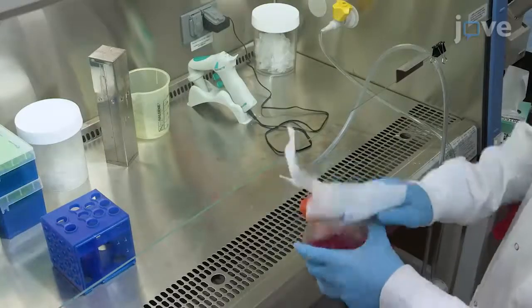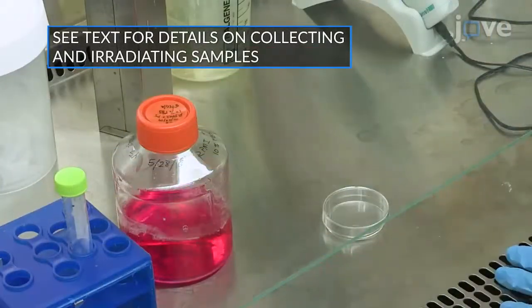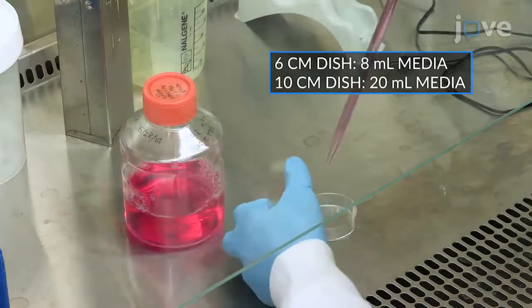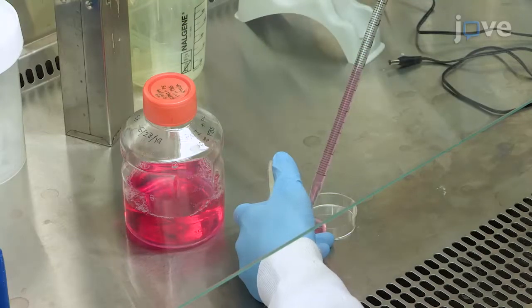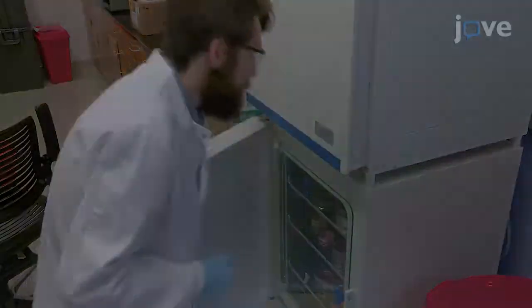After irradiating samples using a cesium source, transfer the irradiated MFPs and complete RPMI media into a biosafety cabinet. Fill 6 cm or 10 cm dishes with enough media to submerge the MFPs. Incubate at 37 degrees Celsius with 5% carbon dioxide for 2 days.